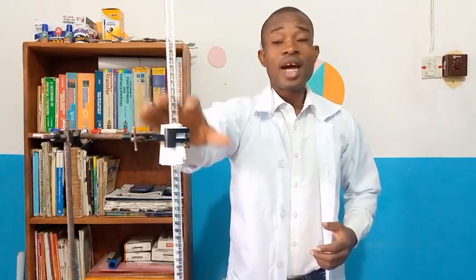This will contain an acid, because we are going to acidify that potassium permanganate with tetraoxosulfate(VI) acid. And so this potassium permanganate would be in the burette. That is our titrant, because we would have a known concentration value of it.